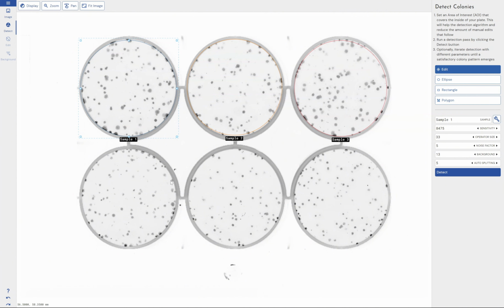It depends on your experimental setup, and if you've got very few spots and you start going towards a really high concentration of spots, you might find that you need different detection settings there. It's completely on you, the operator, and how your experiment was designed to fine-tune these settings for your application and know that if you want to keep them the same or move them, and if that works within your SOP.